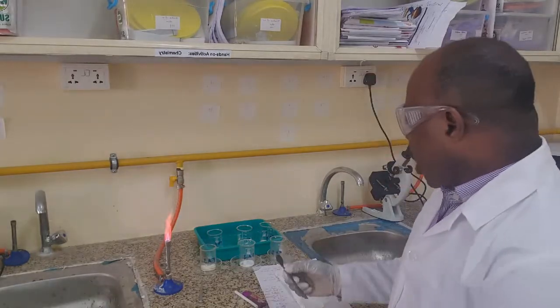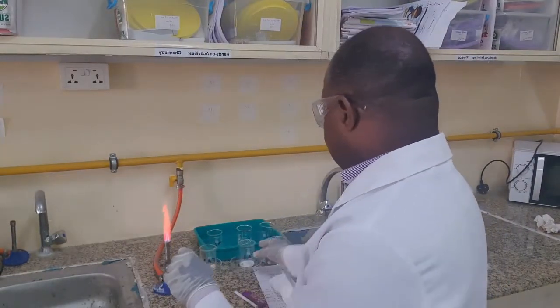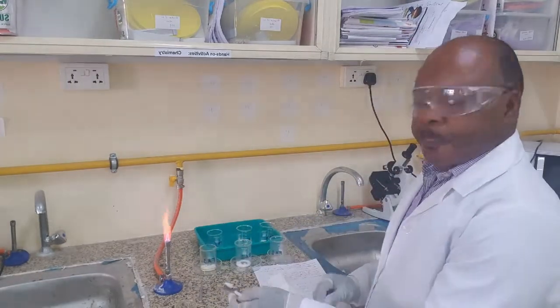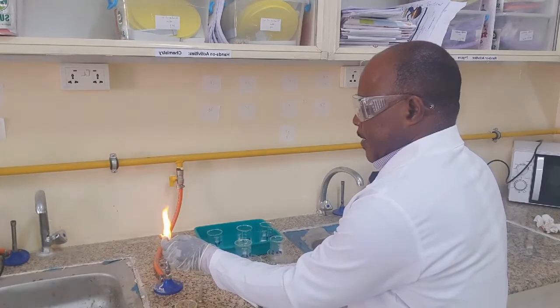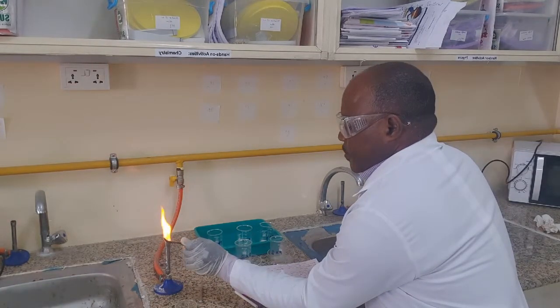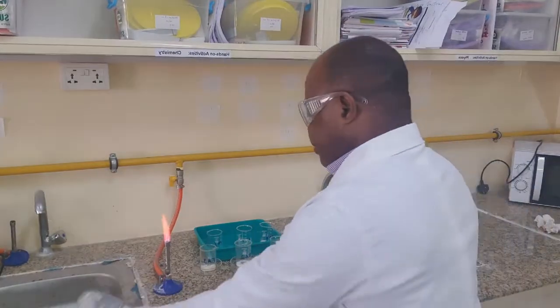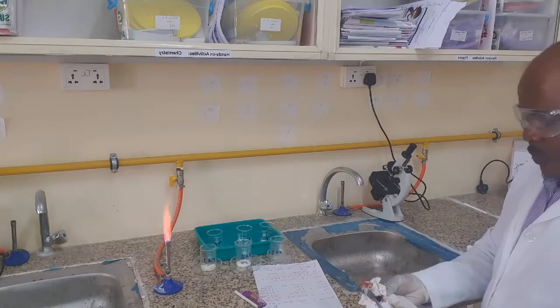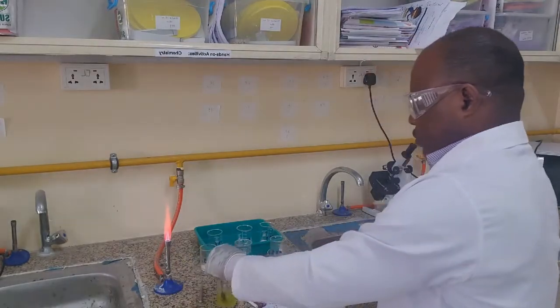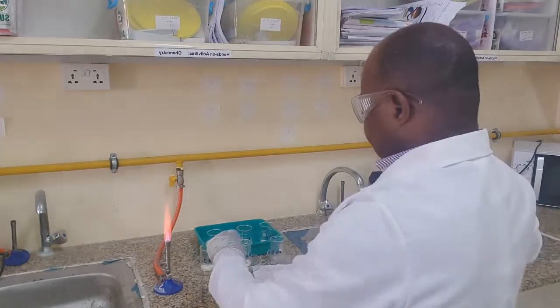We will go now to salt number 2, Fa2. Fa2 gives us a yellow flame.